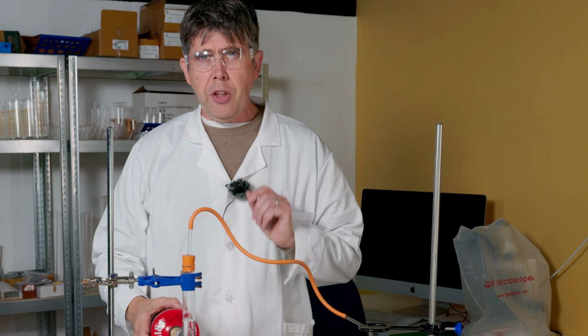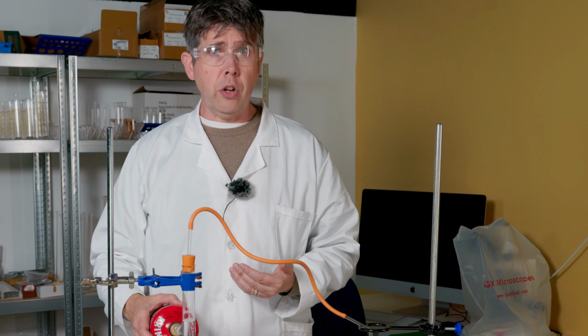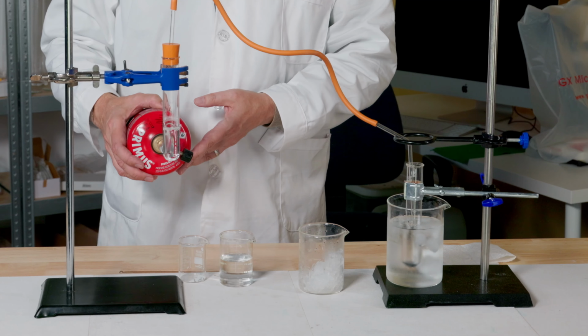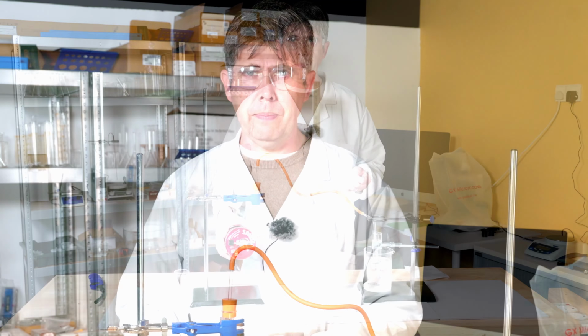By the way, the other big risk here is scalds from the steam, and these can be very nasty. And that's why I've got everything clamped down securely. Don't try to do this by getting your lab partners to hold the glassware stable for you at the bench, as that could really cause a nasty accident.